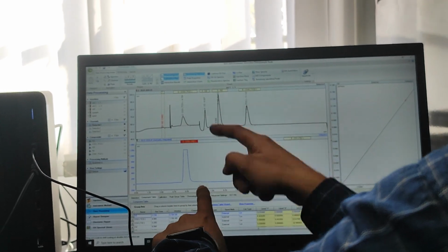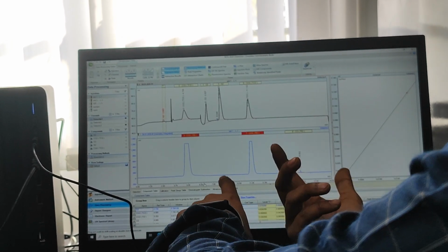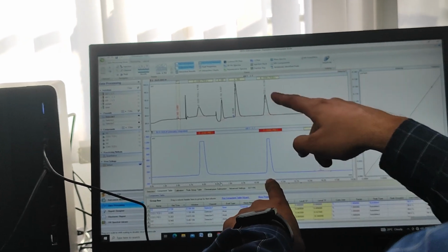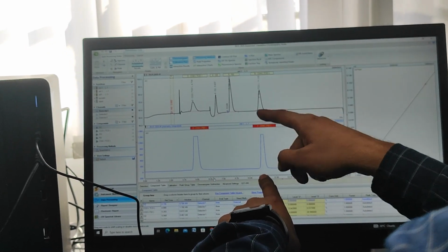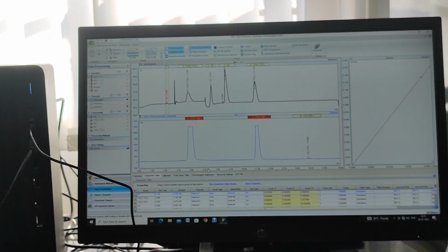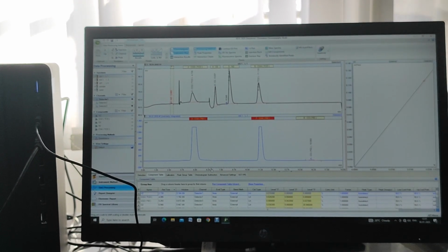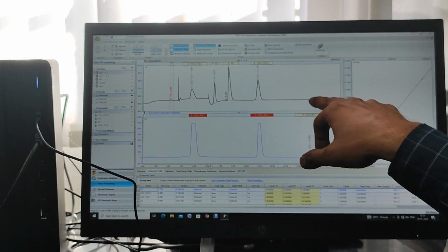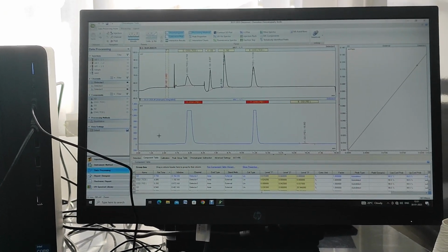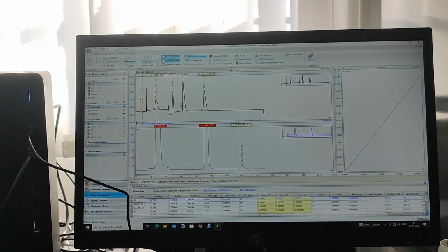Then oxygen, again it is not a hydrocarbon, it cannot be detected in FID. Now nitrogen, even it is not a hydrocarbon, so it is not detected in FID. Now methane is detected at percentage level, that's why it is detected in TCD, and in FID it is saturated because of the very high amount of methane, and this is a hydrocarbon, that's why it is detected. Now time for CO. CO is very low in concentration, it is not possible to detect in TCD, that is converted into methane, now it is detected in FID. See that 100 ppm CO is converted into methane, now it is well detected in FID.